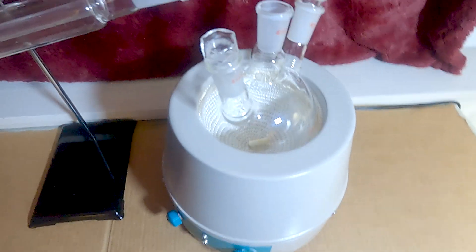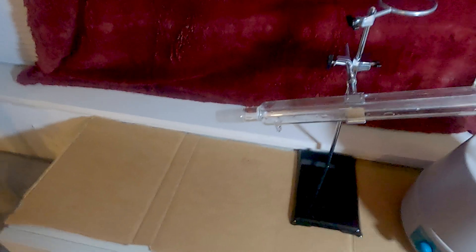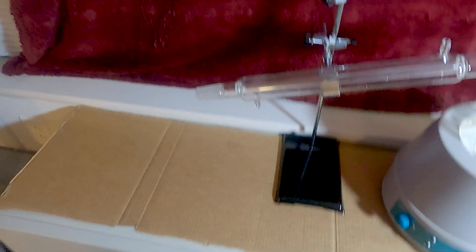Okay, so I'm just gonna have a simple distillation setup: one liter flask, heating mantle, just a regular condenser. And I'm gonna have to cut fractions off of this, so I'll have a couple different flasks.